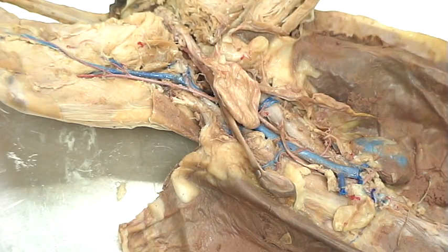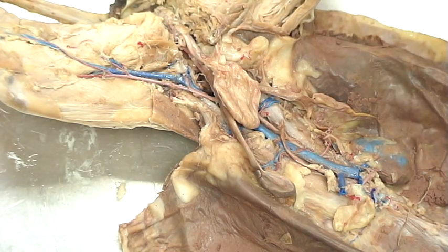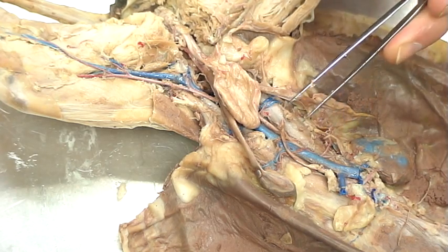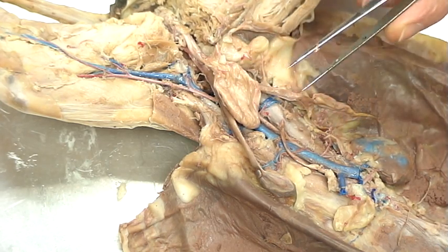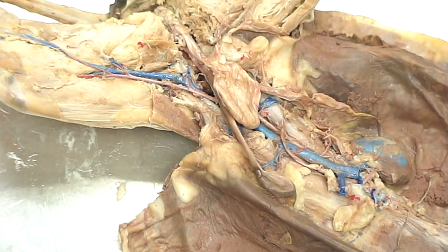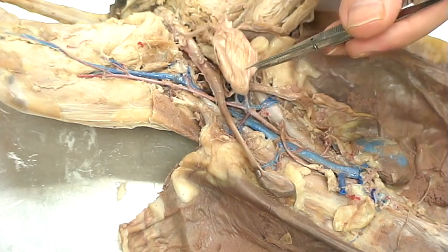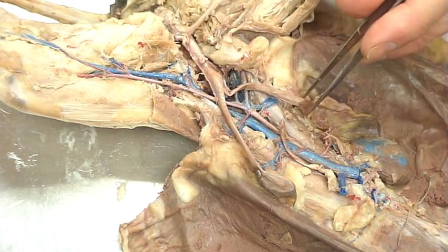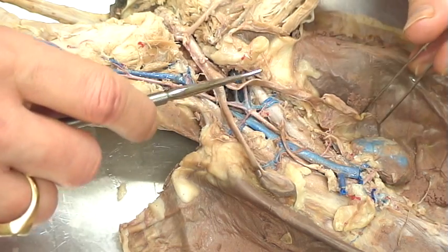When looking at the reproductive system of the female cat, it's important to keep in mind just where everything is situated. I'll keep everything in situ first, and then we'll remove it and take a look at some of those structures. You'll see that the urinary bladder sits on top, and for our purposes, I'm going to lift it away so you can see exactly what I'm talking about a little bit better.